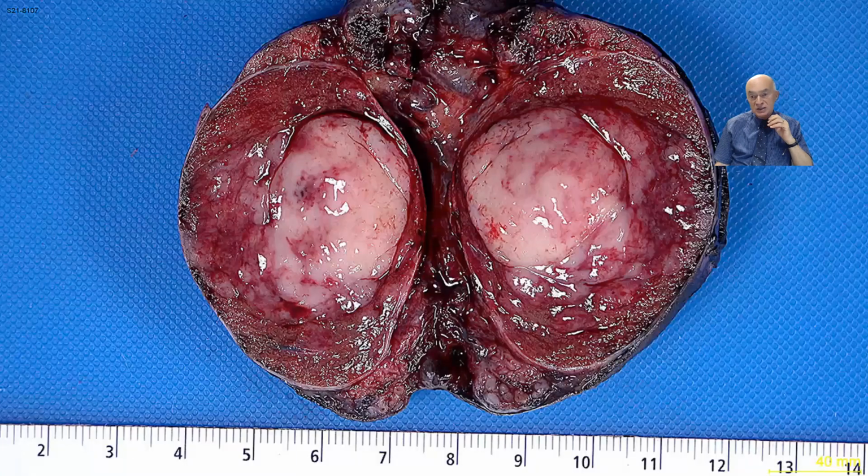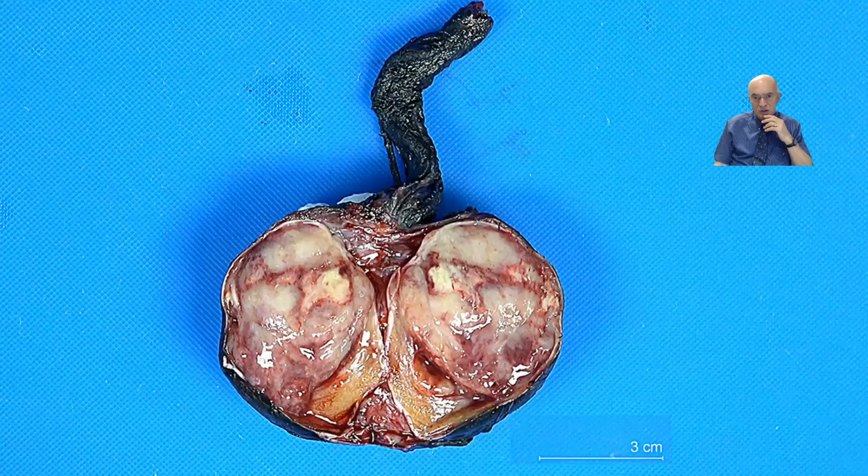And then this is another example of a seminoma, very well circumscribed, present in this nice dissection of this testicle. And then we, again, take representative sections of the tumor itself and areas that most likely could be also suspicious by extension. And then you can see here there is one particular area that could be suspicious for involvement of the albuginea, but the lining of the vaginalis probably is still intact, and any kind of other suspicious areas that can involve the spermatic cord as well.